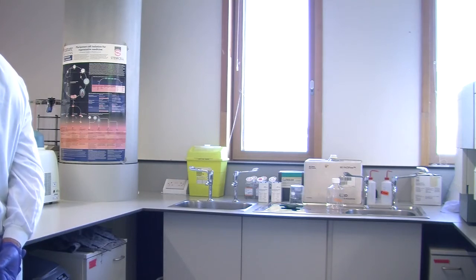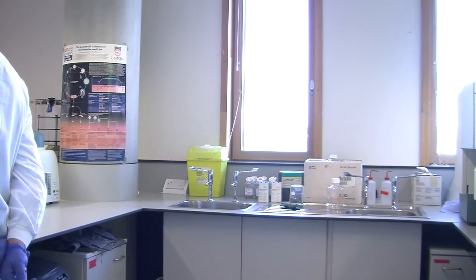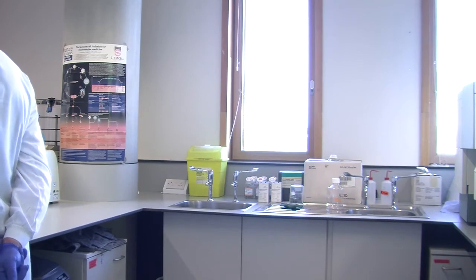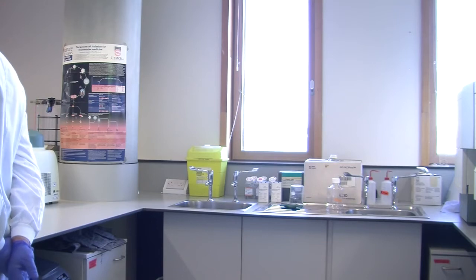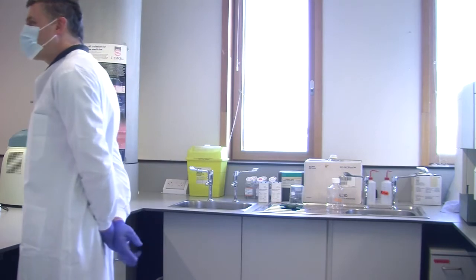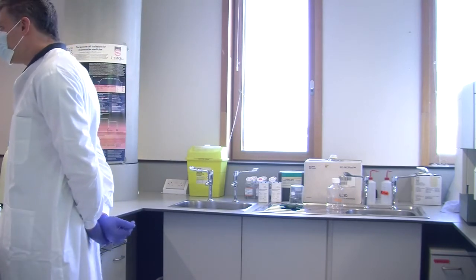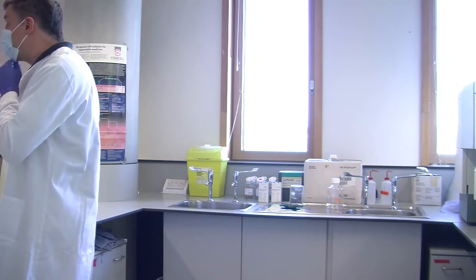So what you need to do is to remove gently the PBS, because the cells are in PBS. The cells will be really attached to the bottom of the tube. So make sure that you remove the PBS gently without touching the cells, the surface of the bottom. You can leave a tiny bit just to make sure that you are not aspirating the cells out. Better to leave a little bit of PBS behind than take too much. If you take too much, you take the cells, and then you have nothing in the end.